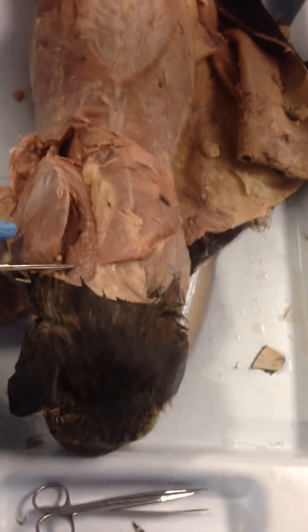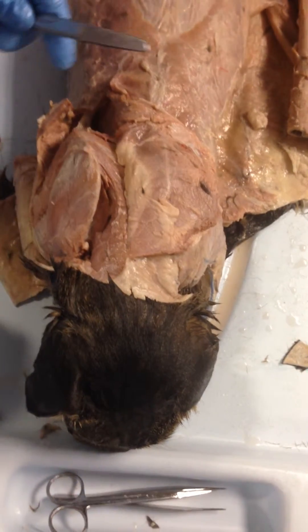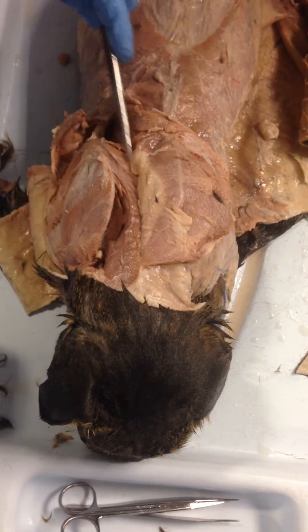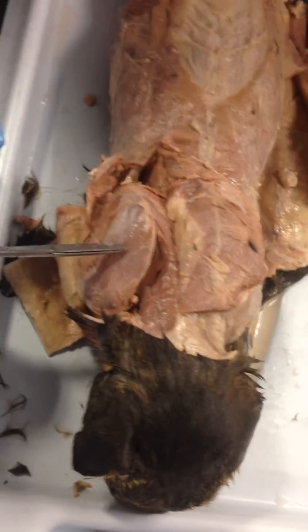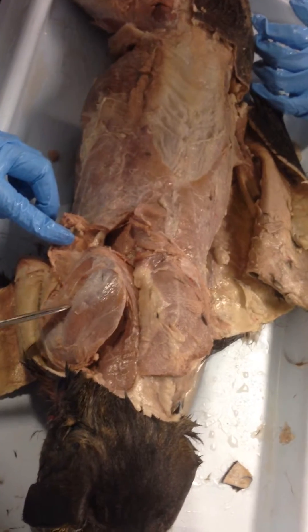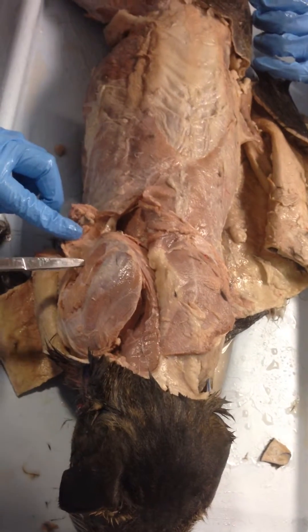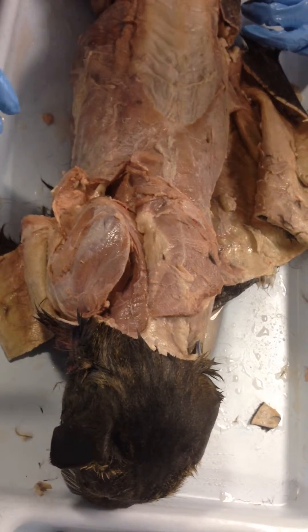We go on, according to the list, we go with the splenius right here. And then we've got the rhomboid group right here. And then we've got the supraspinatus. There's a hard spine right here, and then below that we've got the infraspinatus. And that's that group.